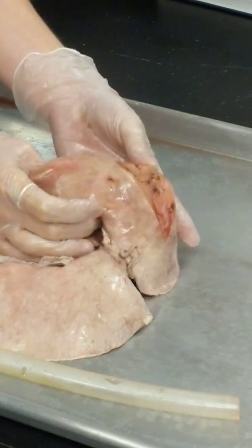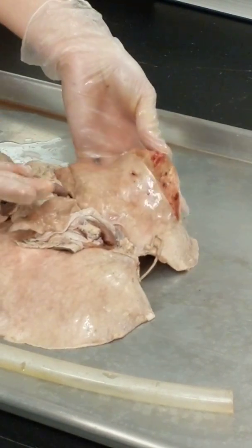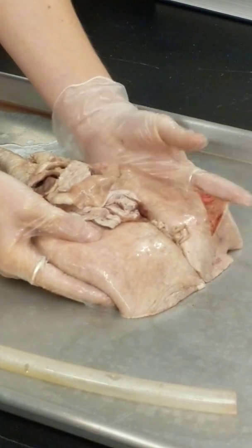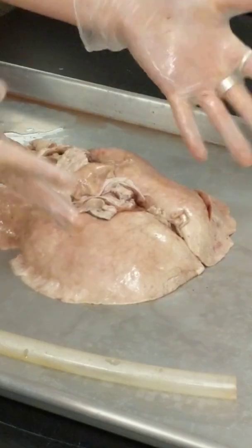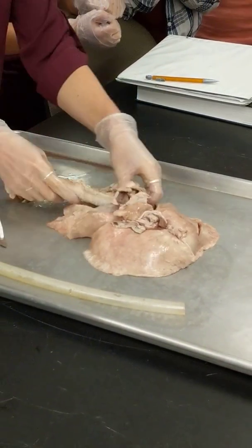That's kind of what the inside looks like. These are substantial enough organs that they are actually consumable. So it sounds weird for us to hear about them being in sausage or whatever, but it's meat. It actually crisps up really well. Mm-hmm. Now that's on film. Okay.